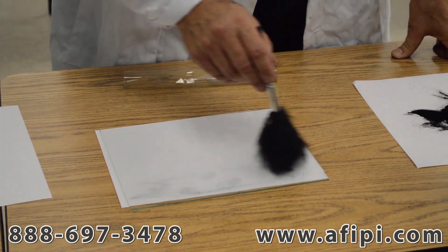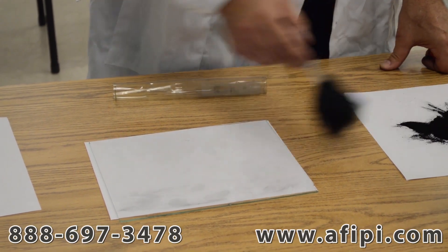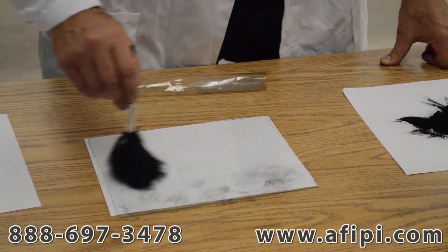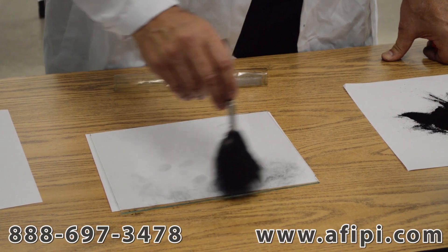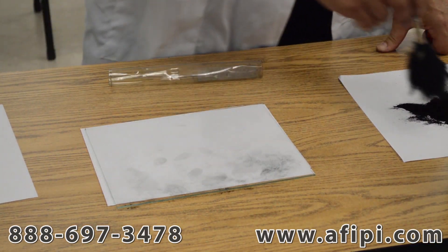The other one is swirling. Swirling is around in a circle, but you need to get more fingerprint powder, shake off the excess, and you swirl in a circle. And as you swirl in a circle, you see that more of the black fingerprint powder is being deposited on the lipids or the fats from your sweat and your secretions.